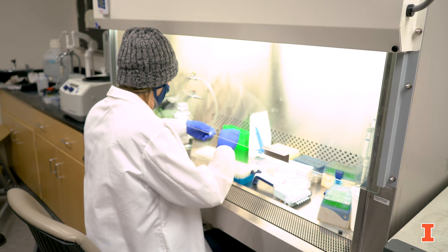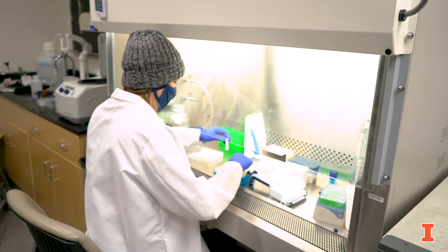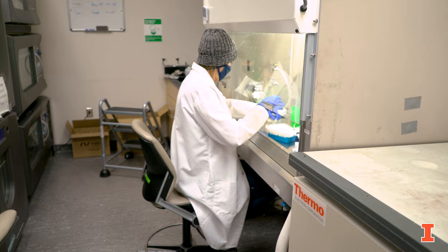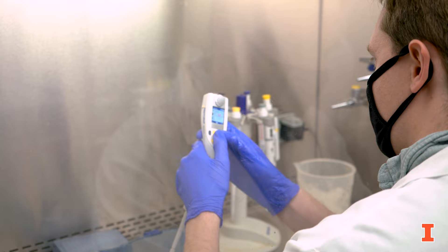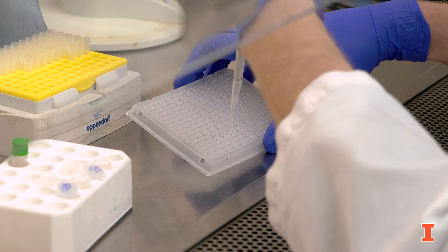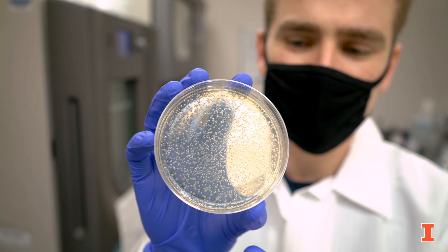Hi, I'm Michael. This is the Dr. Zhao lab here at the Institute for Genomic Biology, and I'm here to show you around the lab and also to show you a few wet lab experiments. In this room we have two biosafety hoods and also five incubators that are responsible for growing up all of our microbes that we experiment on. This is where a lot of the cell work actually takes place for people working on yeast and bacteria, and in the room adjacent to this people work on mammalian cell cultures.